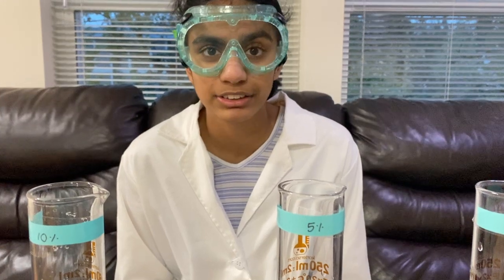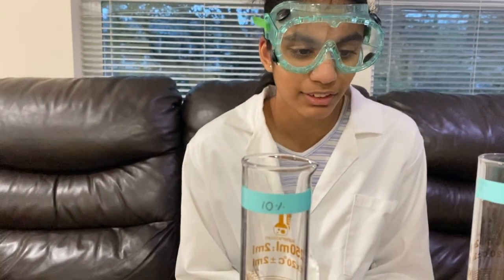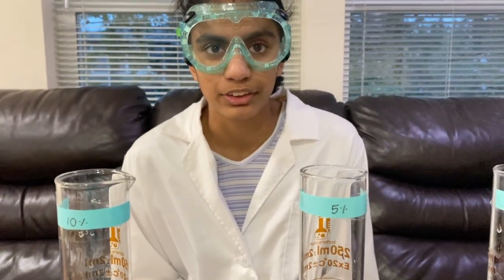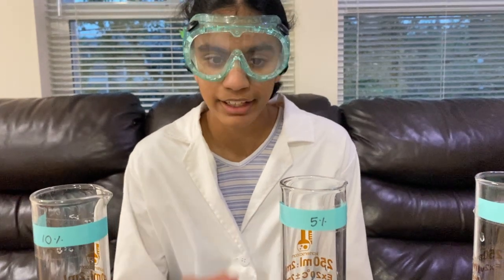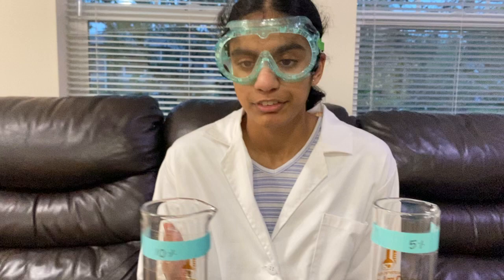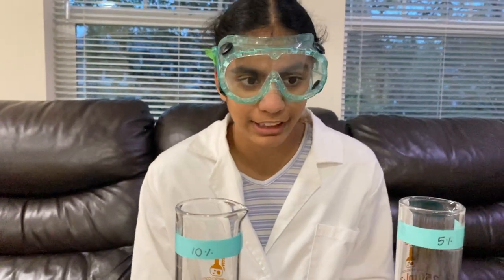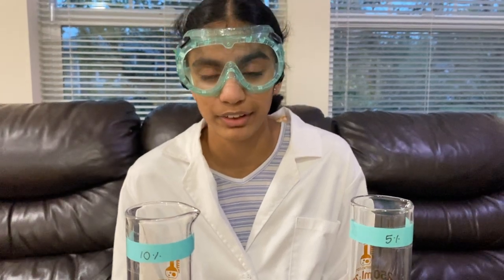The 100 milliliters of distilled water volume accounts for the volume of those 5 grams. So what I did was, I had 80 milliliters of distilled water and mixed 5 grams and made sure they were dissolved 100%. Then I brought the final water level up to 100 milliliters total. For my 10% salt solution, I repeated the same thing, except I used 10 grams of salt in a total of 100 milliliters of distilled water.